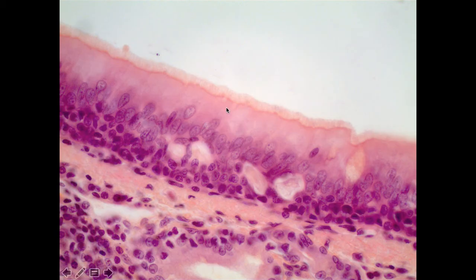The columnar part of the name is just describing the cell shape. These are column-shaped cells, very tall and narrow. And then there are two additional features that we see here. You'll notice along the surface appears a lot like the microvilli we saw in the previous couple slides. They're in fact not. These are referred to as cilia. And even though cilia and microvilli may appear similar, it turns out that cilia are much larger, they're longer. We can almost start to make out individual filaments or extensions, where that was not even possible when we were talking about microvilli. And functionally, they're very important in their differences.